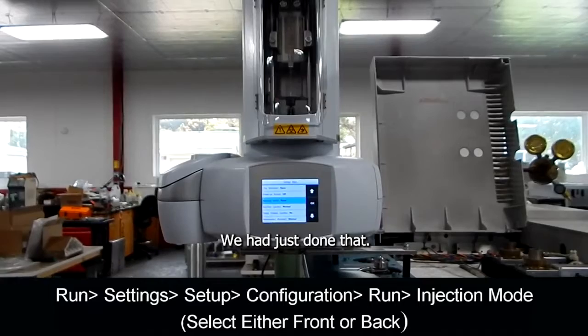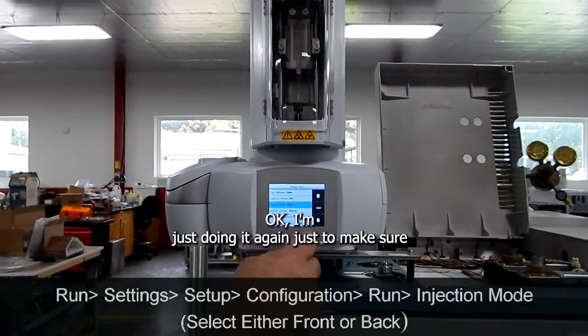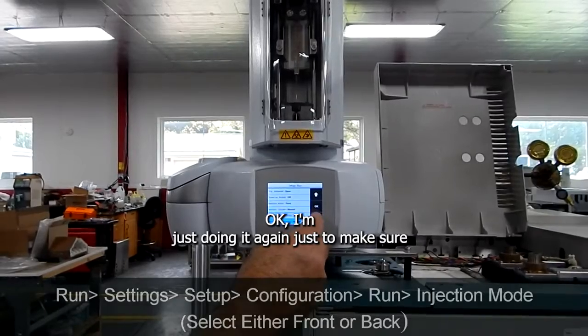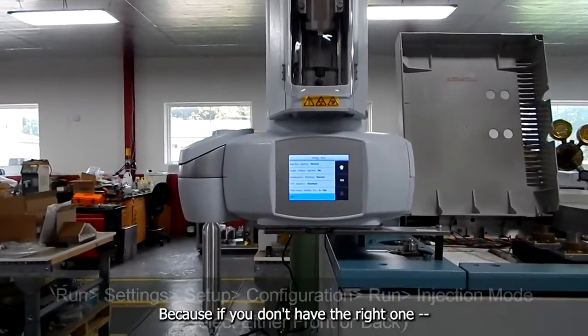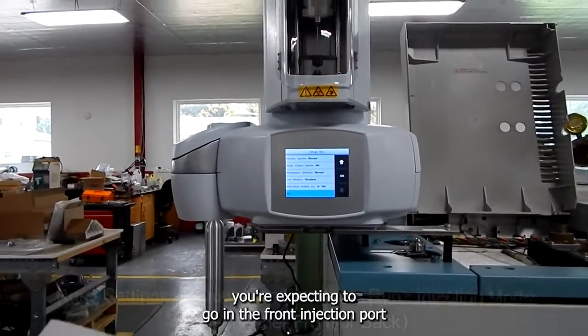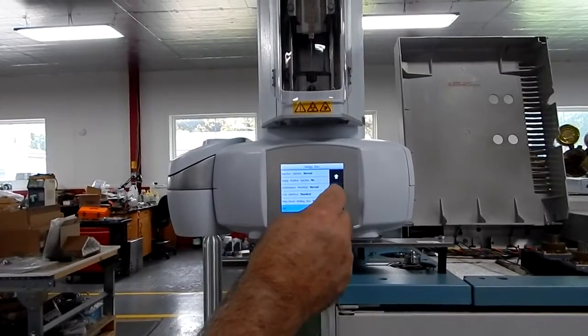We had just done that. So hit OK. I'm just doing it again to make sure we have the right one, because if you don't have the right one, you're expecting to go in the front injection port, it's going to go to the back injection port and disappoint you.